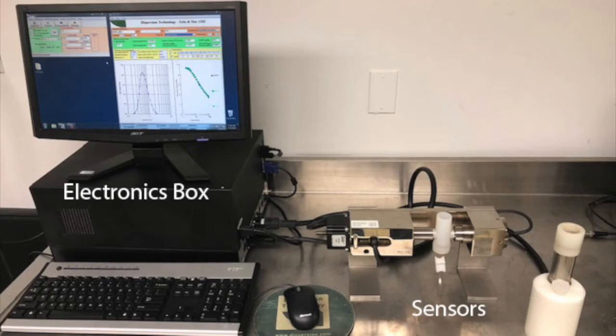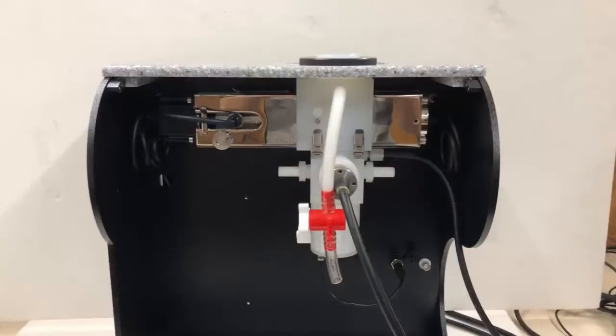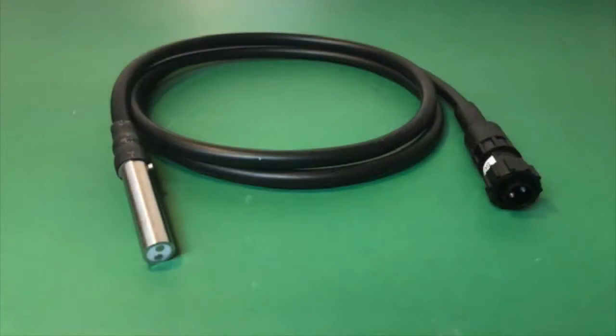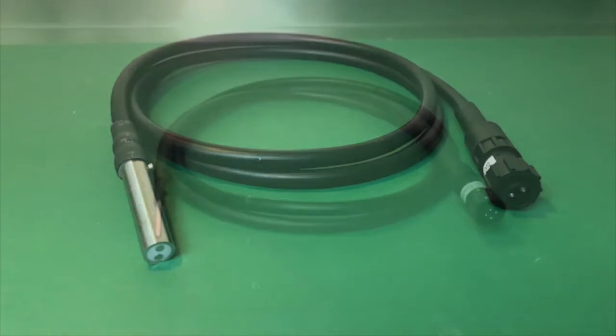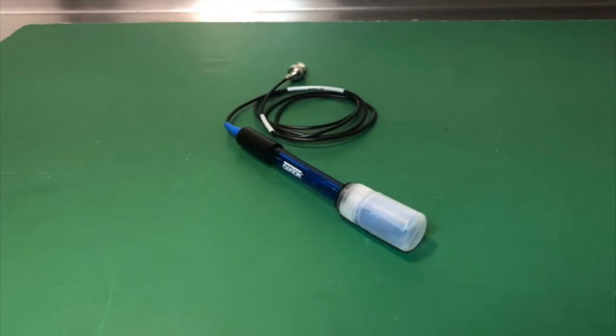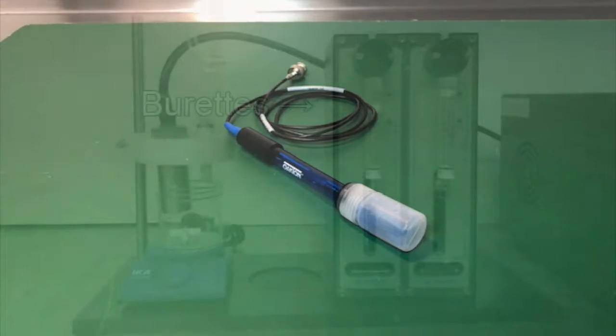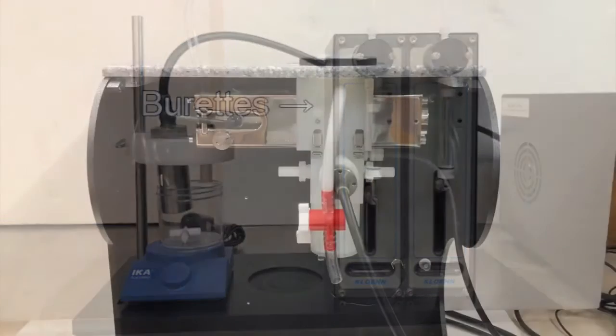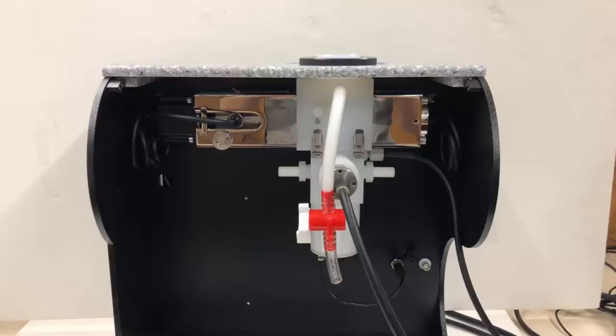These sensors include an acoustic sensor for particle size, a Zeta Potential probe, an aqueous conductivity probe, which is optional, a temperature probe, which is also optional, a pH probe, which is optional as well, and burettes for titration, also optional. There are several types of stand for accommodating these probes, allowing for sample handling with or without mixing, as well as minimizing sample volume. This setup is the standard DT1202 setup.